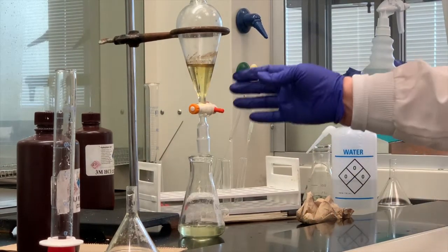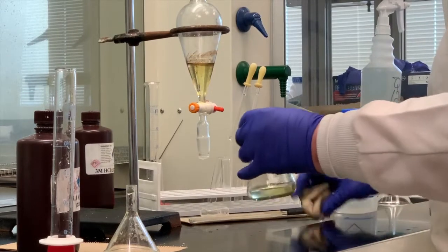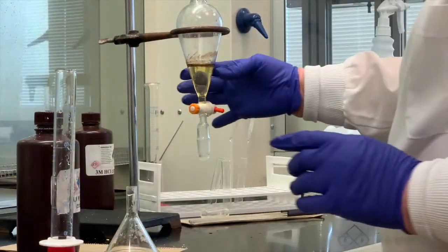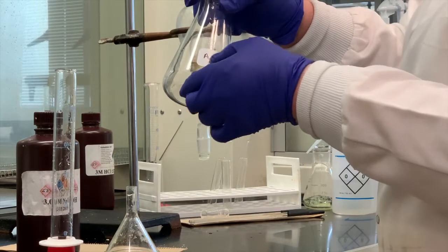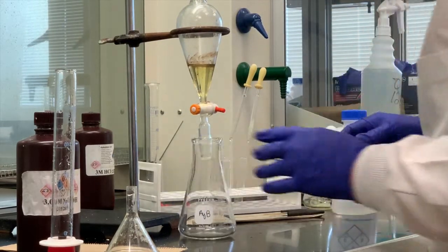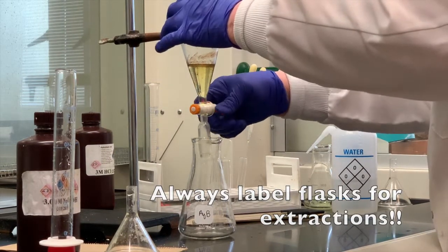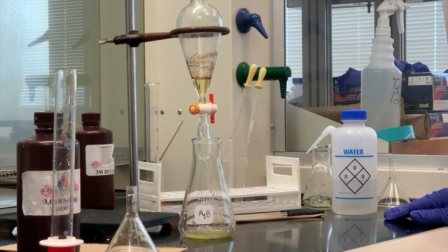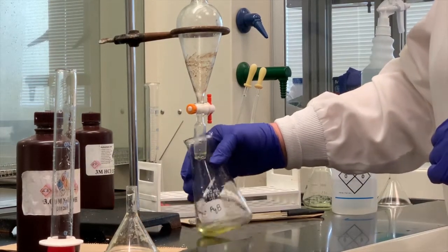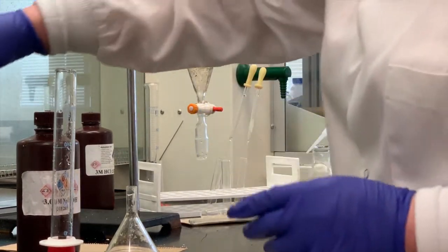So now I've separated the bottom layer, which is the neutral. And again, the neutral should only contain naphthalene. I'm going to set this aside for a second. Now this is our basic layer because we added the sodium hydroxide. So I'm going to collect it in the aqueous B, aqueous base. I can't emphasize enough, make sure you label things, because if you go, wait a minute, what was that flask? So make sure you label everything before you start. We're going to drain all of this material, which is our aqueous base. Again, aqueous base contains the salt of benzoic acid. So all that has been drained. I'm going to close my stopcock. I'm going to save this aqueous base.